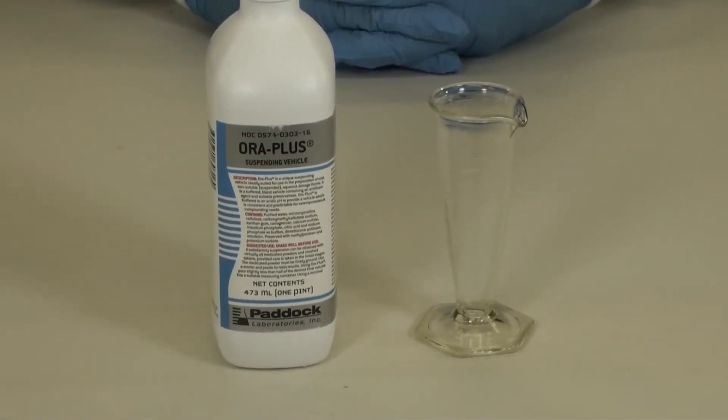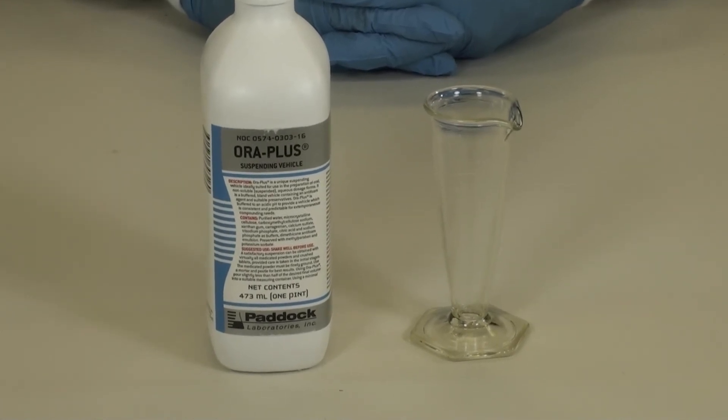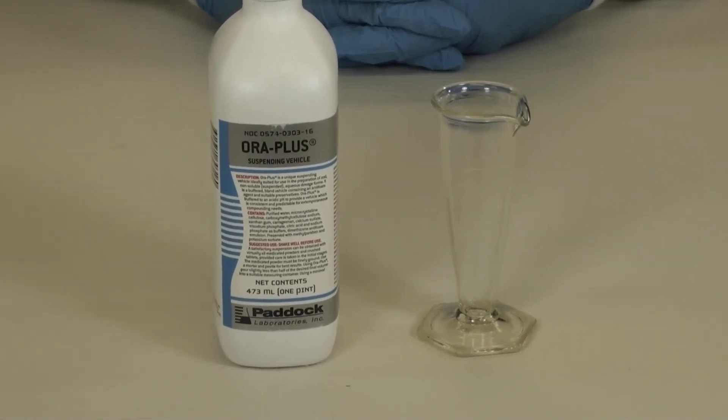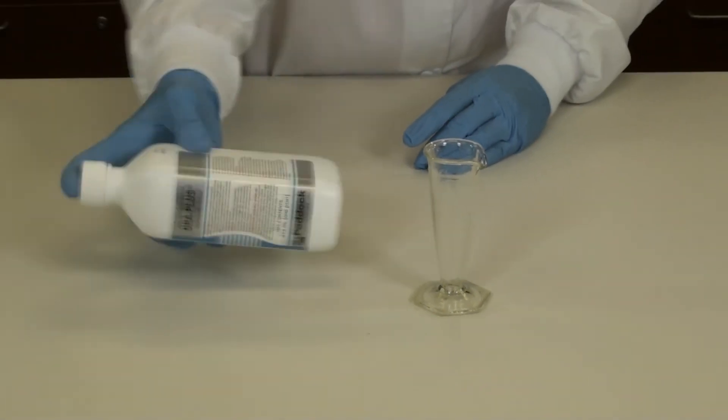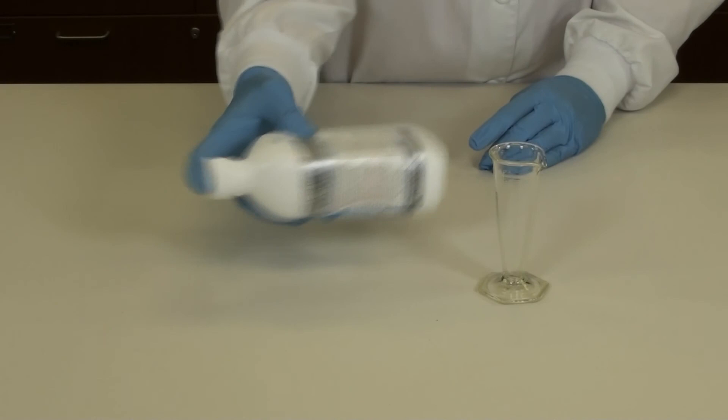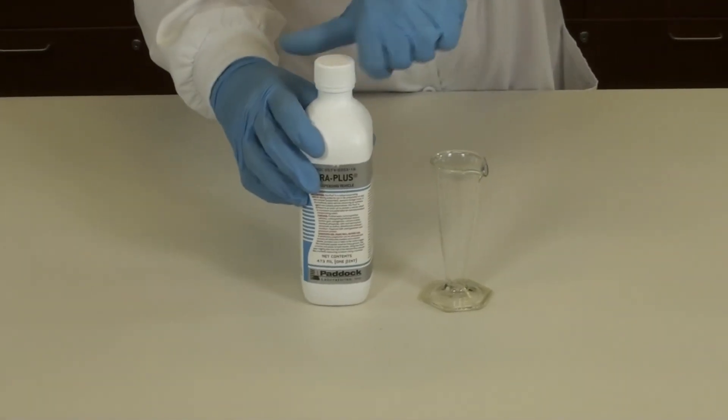You're now ready to measure the required amount of your suspending agent. In this case, we are using Oraplus. Remember, your suspending agents need to be shaken well prior to the measurement process.